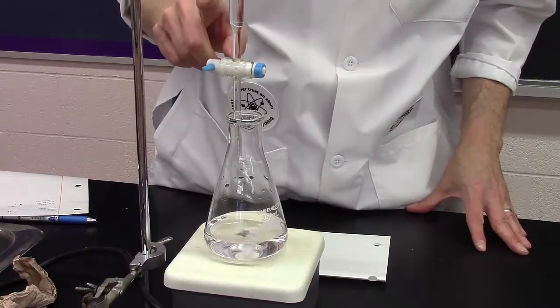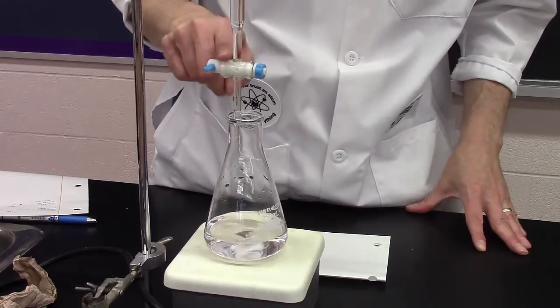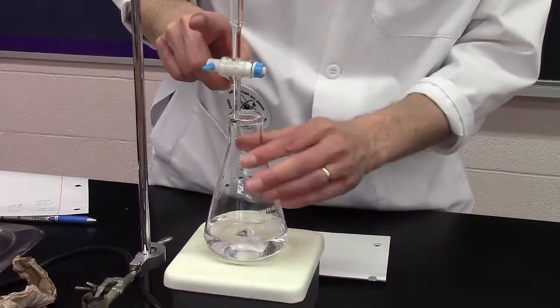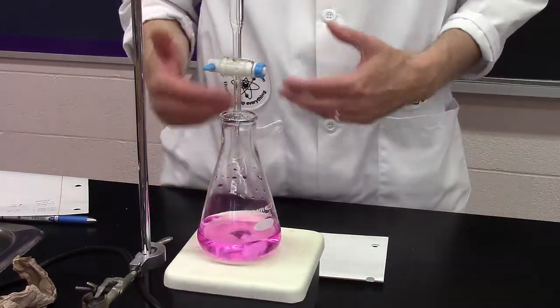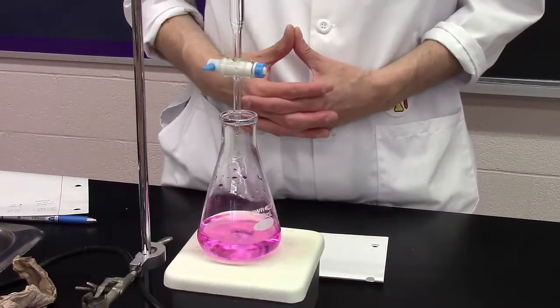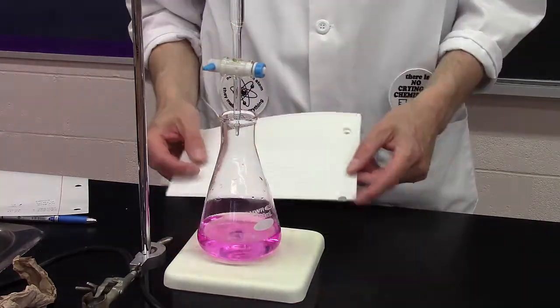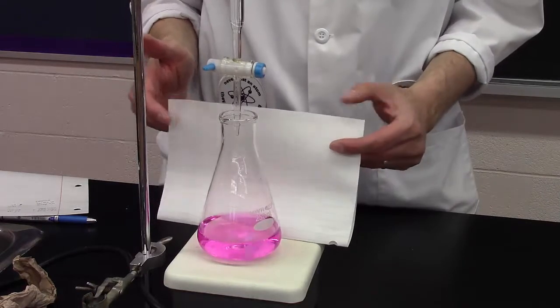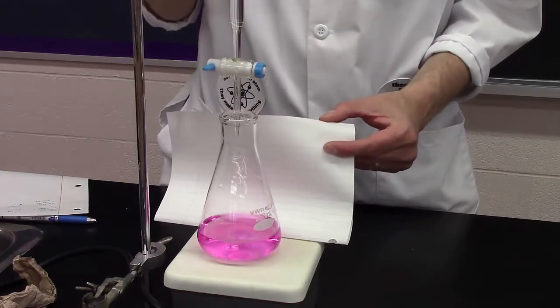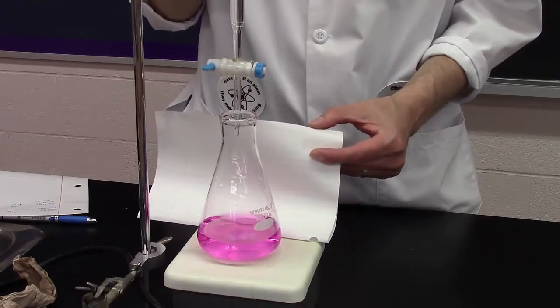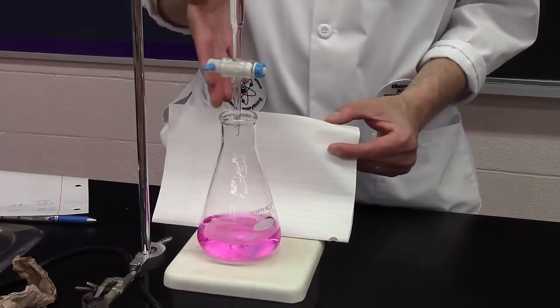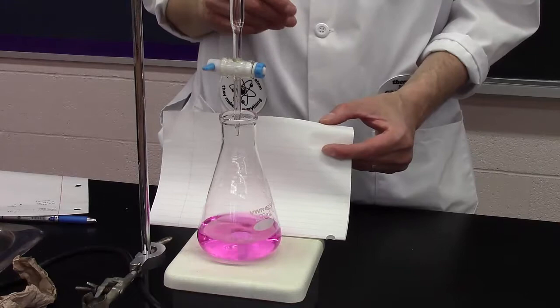And then I get - it's no longer a faint pink, it's actually a little bit darker than I'd like. The reason I did that was to show you that when you get close, it's really easy to overshoot. That's a pretty good pink color, better than what I had on the previous one.